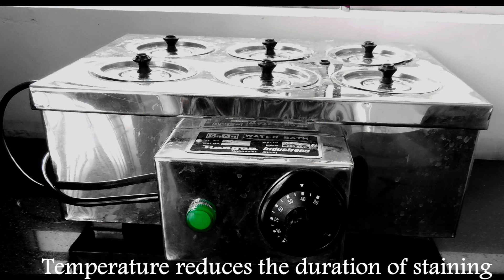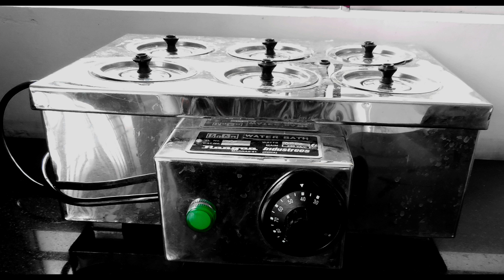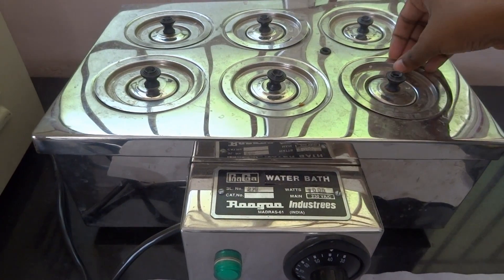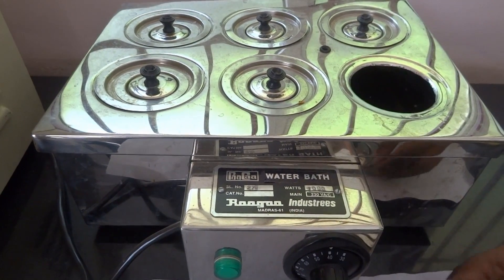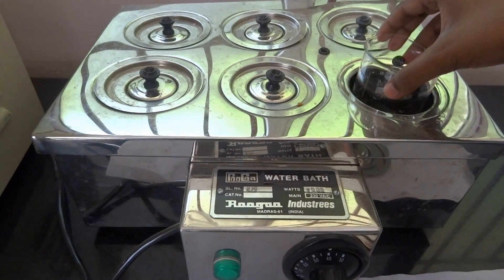For optimum level of staining, set the water bath at 40 degrees Celsius. Keep the beaker in the water bath for about one hour for the optimum level of staining.